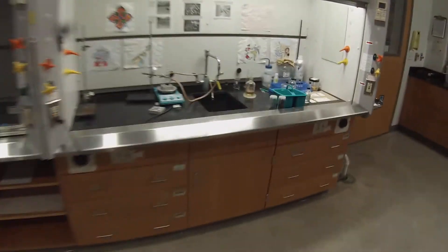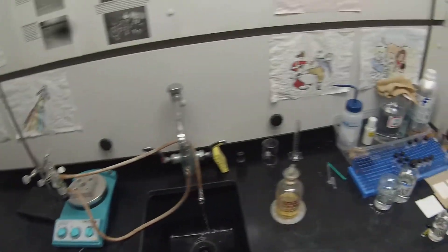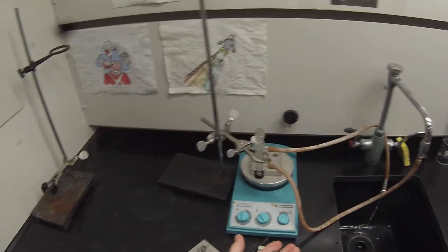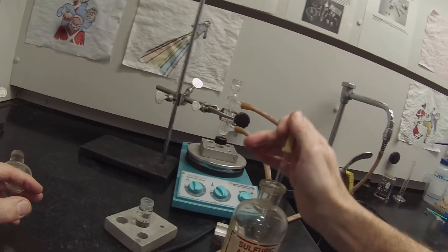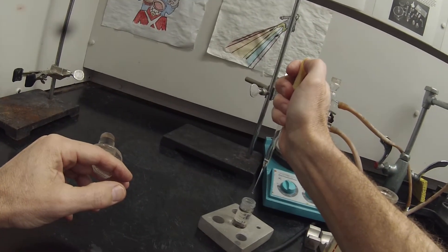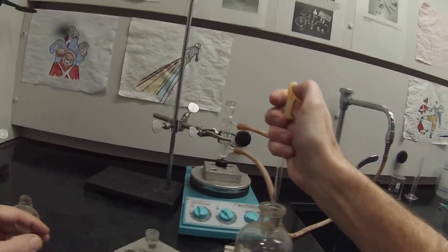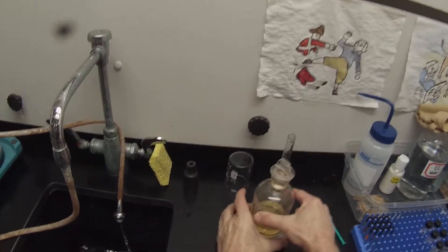And now I want to add three drops of the concentrated sulfuric acid. And this I want to be certain not to get on myself. And to avoid contaminating the cap, it's got one of those penny head stoppers so I can hold it in my fingers. And I just want three drops, just as a catalyst. There we go. I'm going to rinse that before I put it in the glass waste because it has sulfuric acid on it. Set that aside.